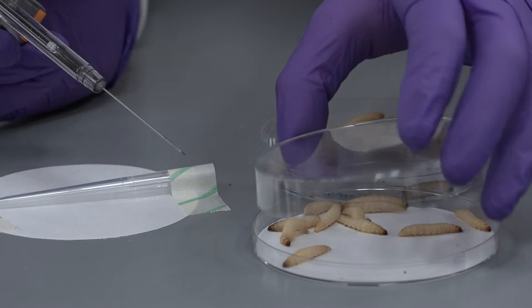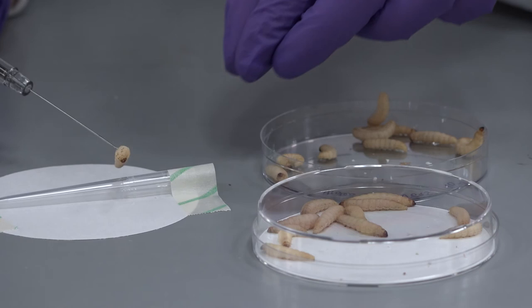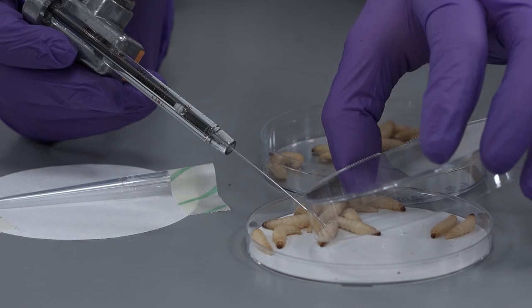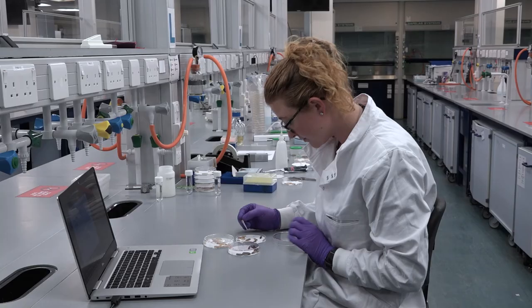You would need to consider your controls. As this is a co-injection, all controls will require a double injection too. For example, you would inject your immunomodulator and PBS for your non-infected control. A second control would be immunomodulator and organism, and you will also need a control for your pathogen and PBS.